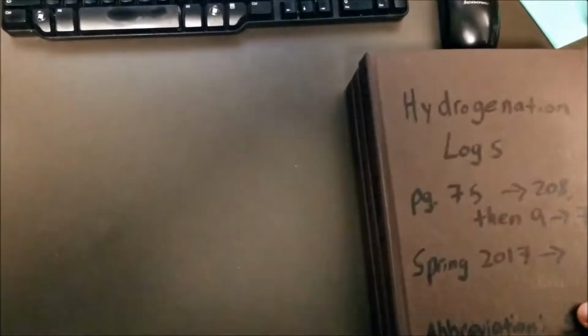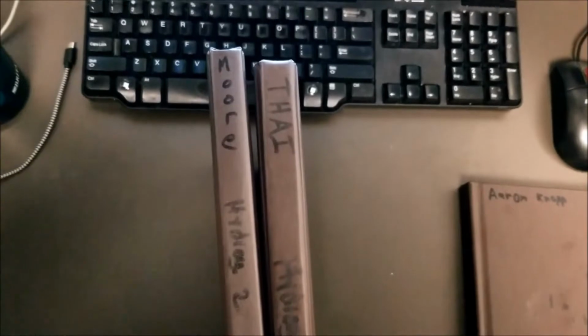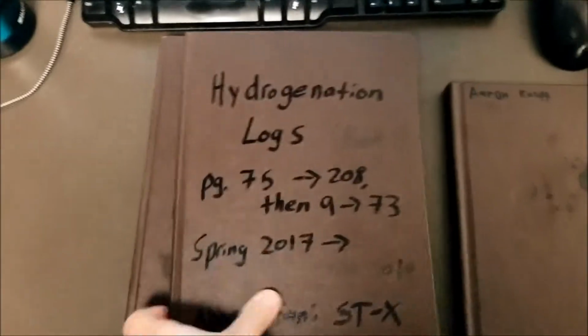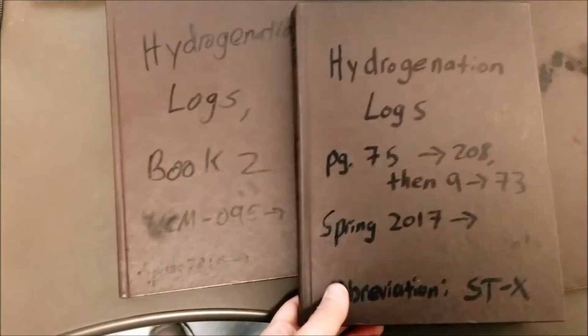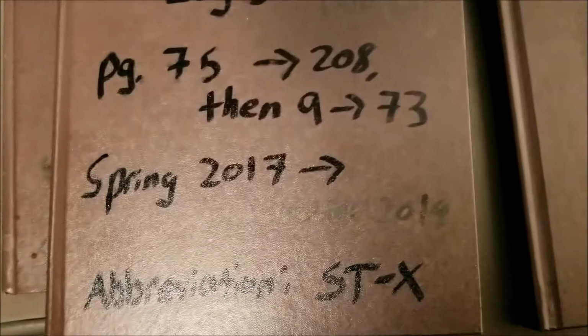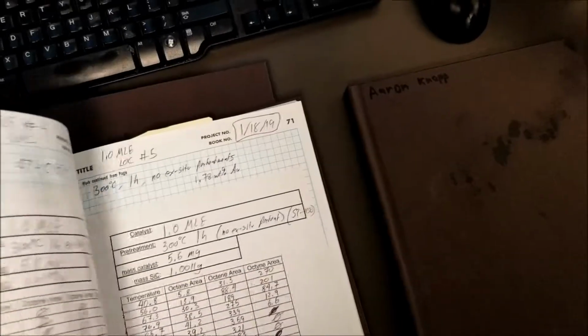So if you're interested in the alkyne hydrogenation results, you want the notebooks that have Stephen Tighe's name on them and Will Moore's name on them. So the first one is Stephen's notebook, and they both have hydrogenation logs, books 1 and 2 written on them. I can't see this too well here, but spring 2017 to winter 2019. So initially, he was still using the notebook.